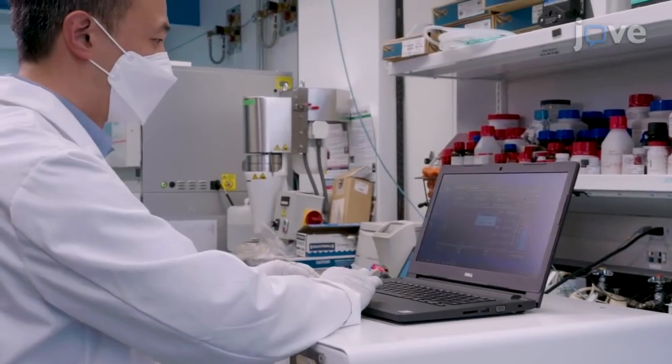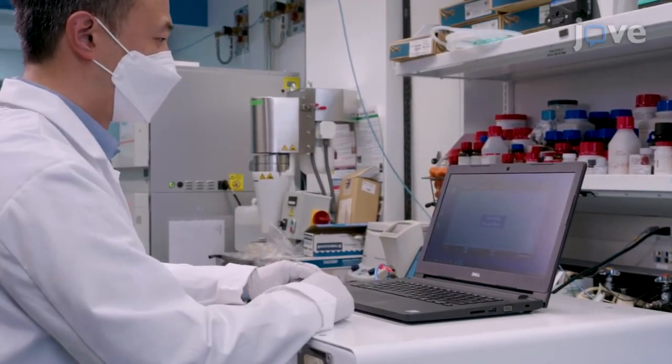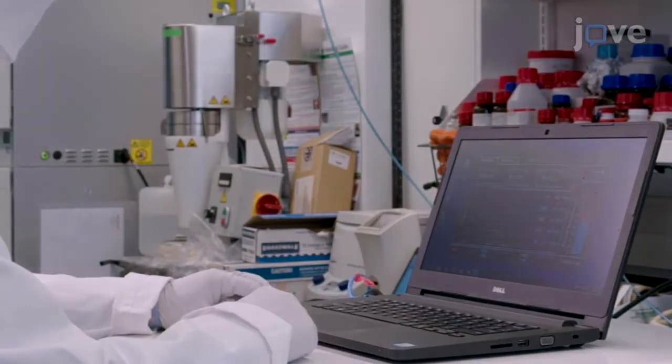To prime the system with harvested cell culture fluid, turn on the acoustic wave separator and open the associated software.